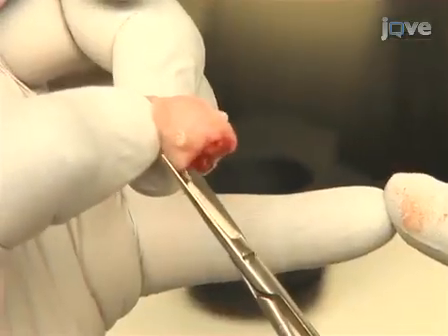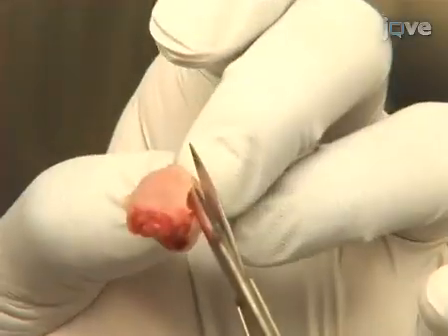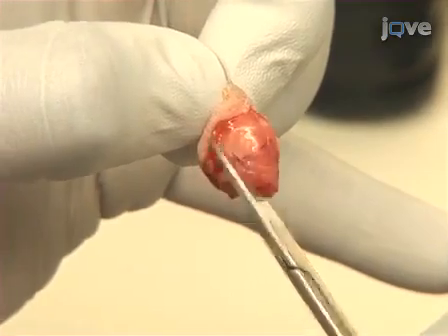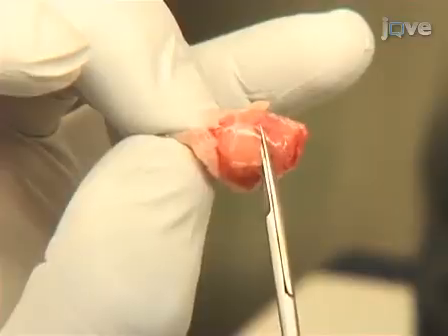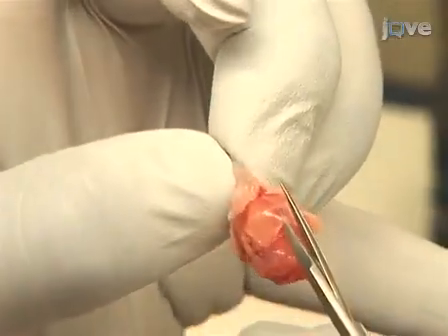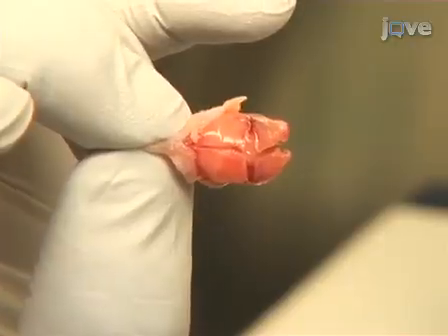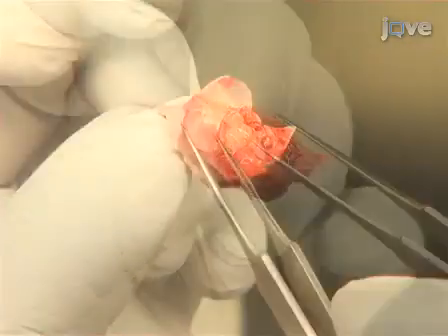After decapitation, begin brain removal by first making 2 lateral scissor cuts to remove the skin from the scalp. Then cut the skull open using fine eye scissors, making 1 sagittal midline cut and 1 coronal cut at the cortex-cerebellum junction. Flip back all 4 of these skull flaps to expose the brain.